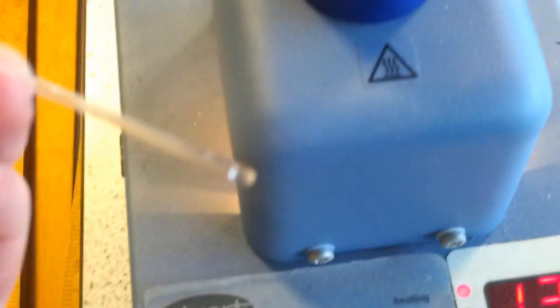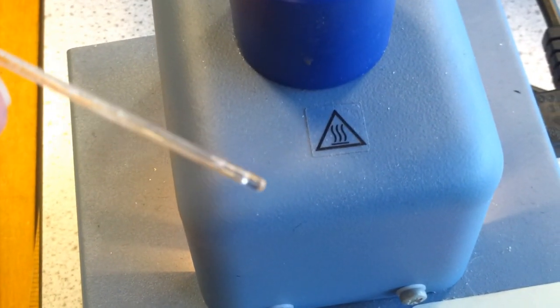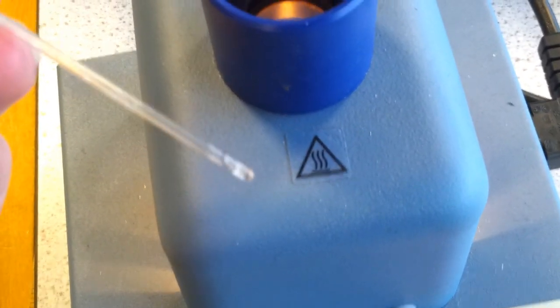134 degrees. And that is all melted. There we go, you can just about see that that's now a liquid, so that melted.